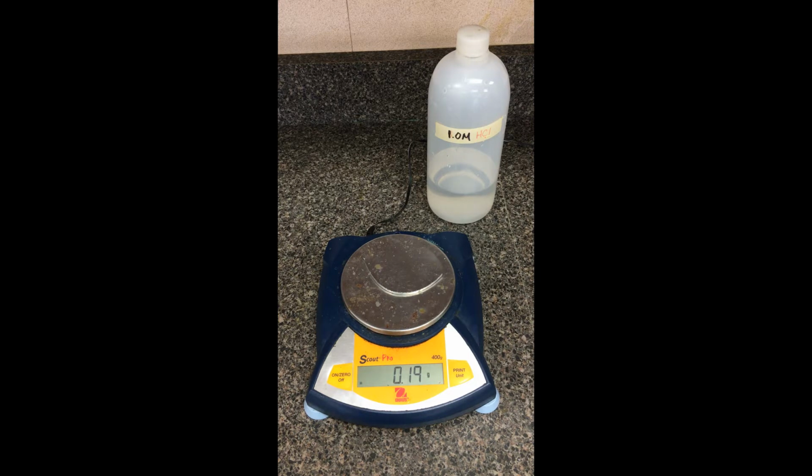Because I'm going to, using a ruler, measure 1 centimeter increments, I'm going to rip it into 11. You can take this mass here, divide it by 11, and that will be the mass per piece that's going to be dissolved. So see you again in part 1.